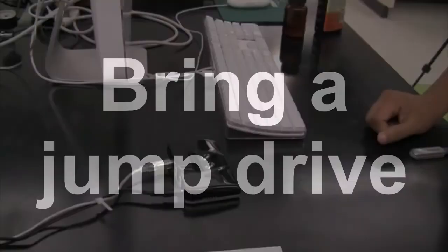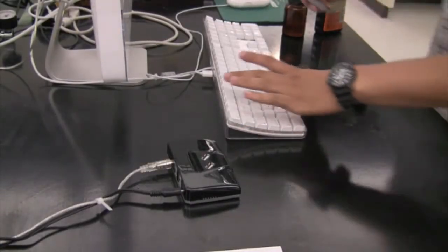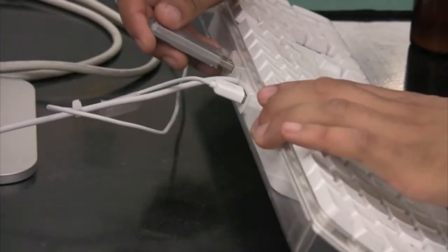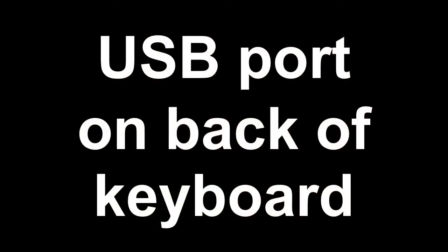You need to bring a jump drive to the lab so that you can save your data onto it and bring it home for your lab report. So, before you go to save your data, take your jump drive or USB key and insert it into one of the USB ports on the computer. Now, some of the computers might have a USB hub connected to them. If they do, you can use that. But if not, it's easy to find a USB port on a Macintosh computer. It's always located on the back of the keyboard.